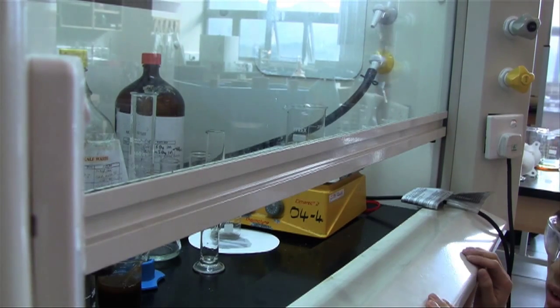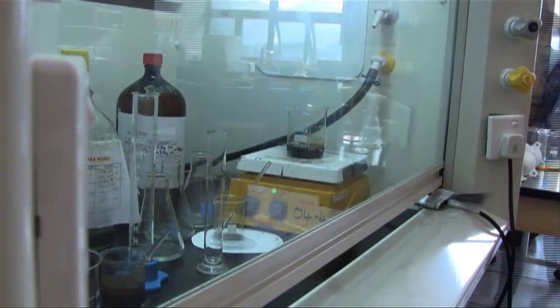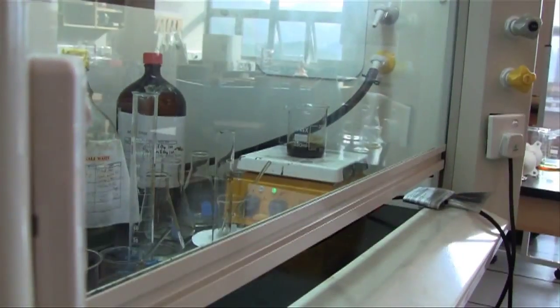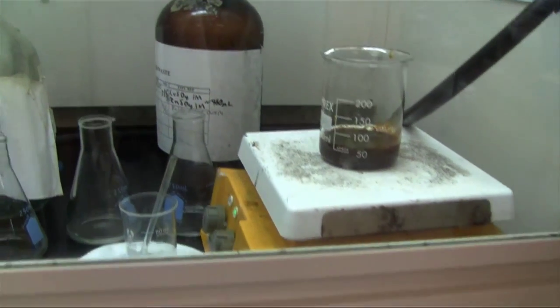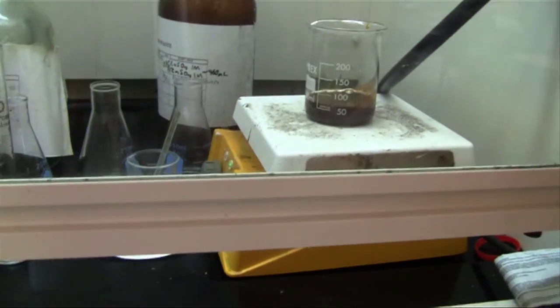From here, we can see that the solutions have created black magnetite. We placed a magnetic stir into the solution to speed up its mixture.